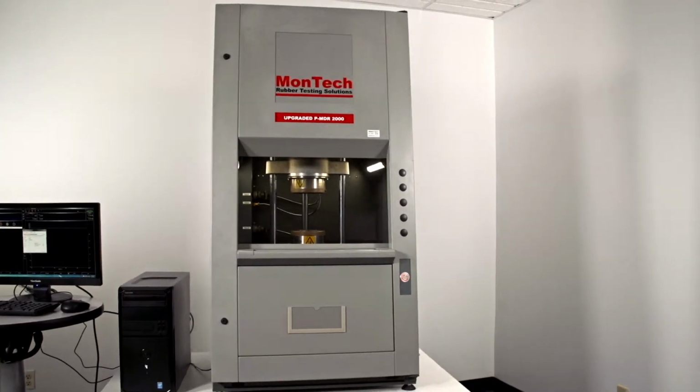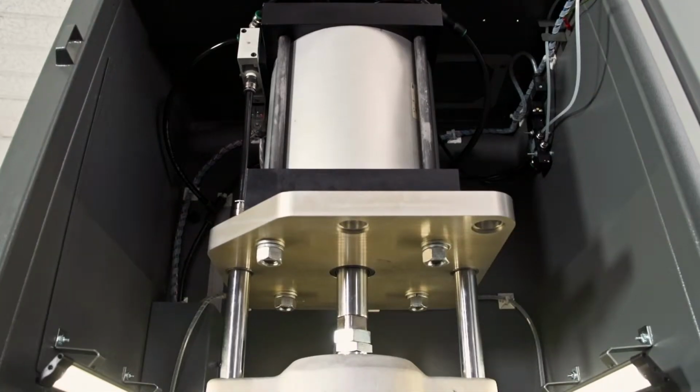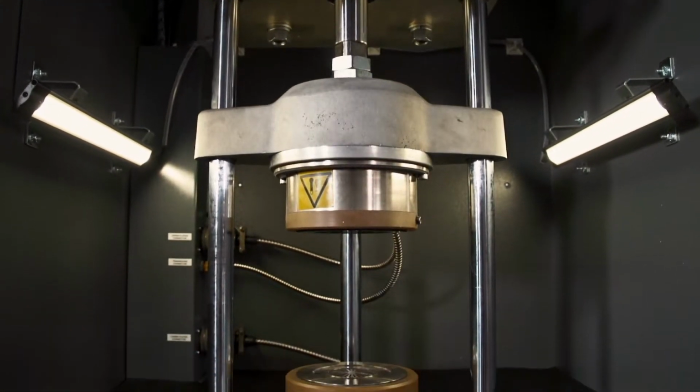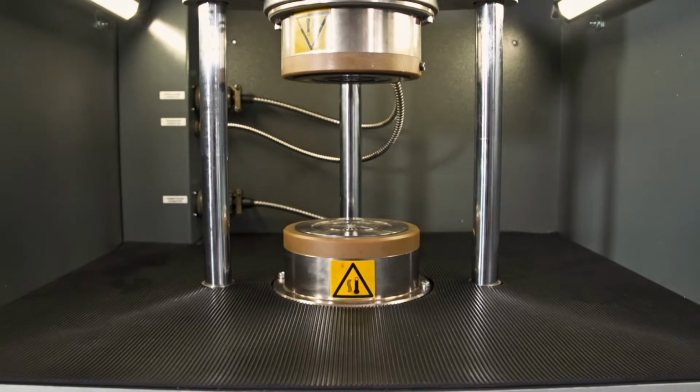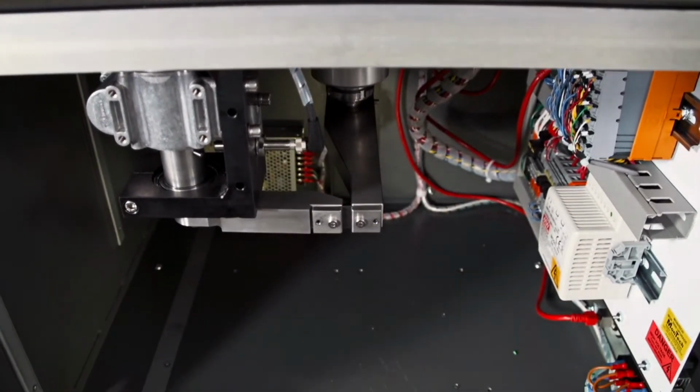MonTech's P-MDR 2000 upgrade is a complete rebuild, performed in our ISO 9001 certified facility. We completely disassemble the instrument, rebuild the main cylinder, and equip it with a new solenoid valve. The torque sensor is tested to ensure linearity, repeatability, and hysteresis.